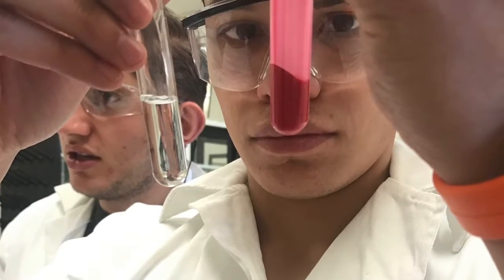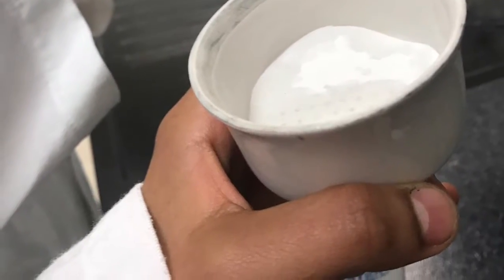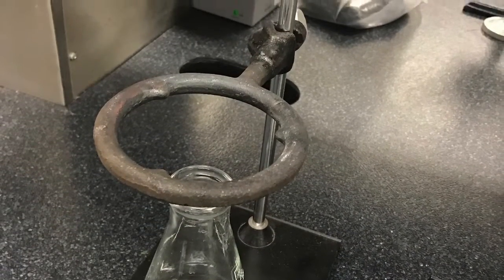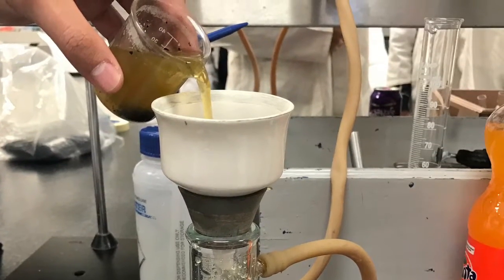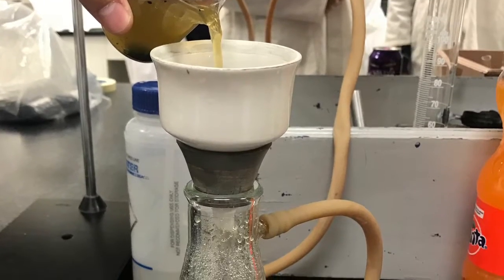Vacuum filtration is mainly used to separate solids from solvents. We used two methods of filtration, and we noticed that vacuum filtration is faster than the other. In both methods, the activated carbon is very important. The results are better if the carbon is slender or thin.